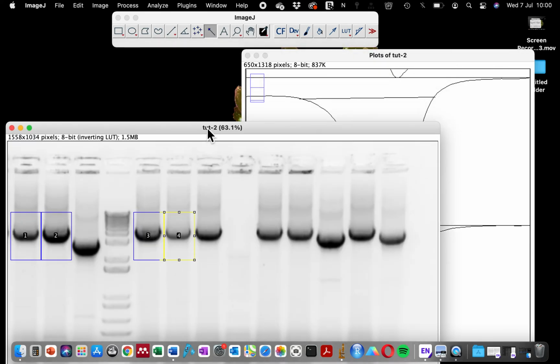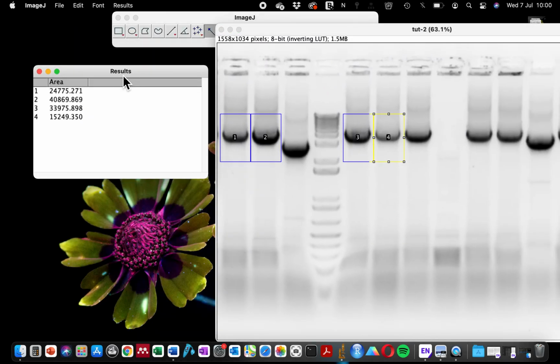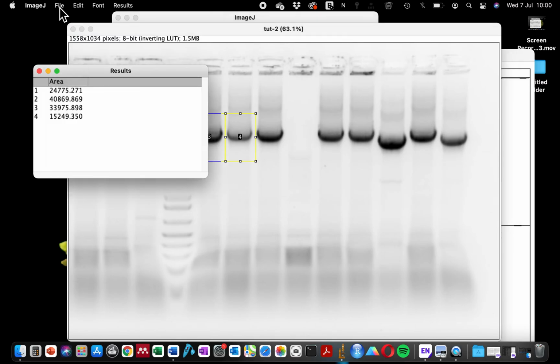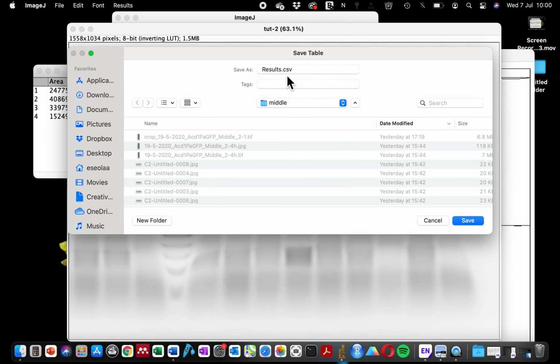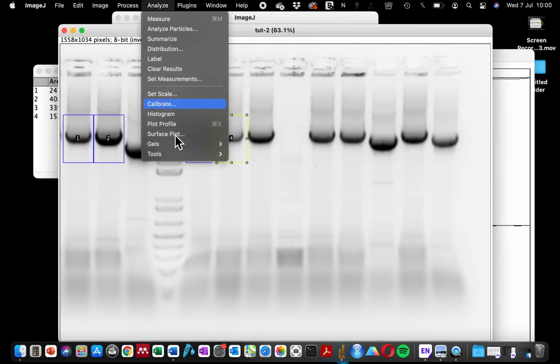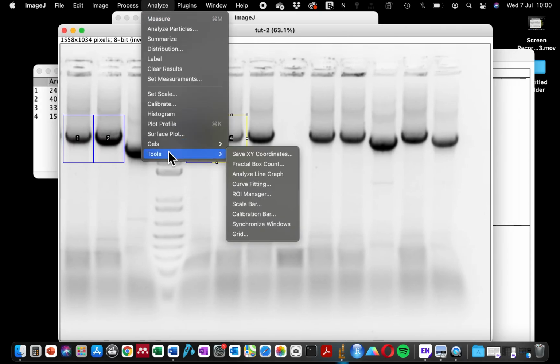You can save the value for the first one. If you need, you can save this as a CSV. So if you click save as, it will save your quantification as a CSV, and then you can open it in Excel.